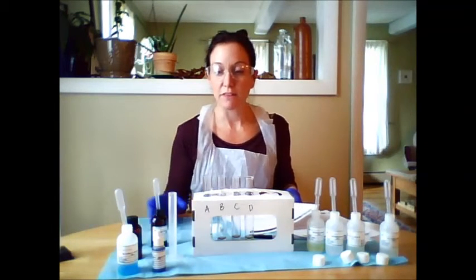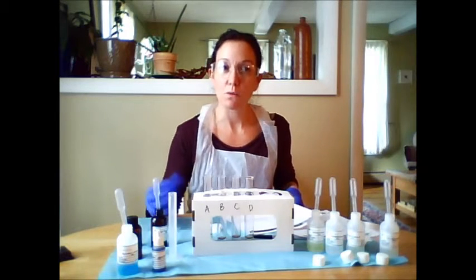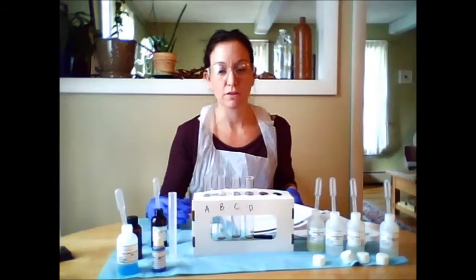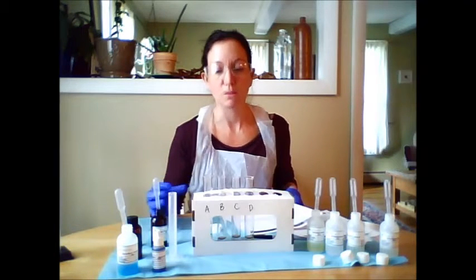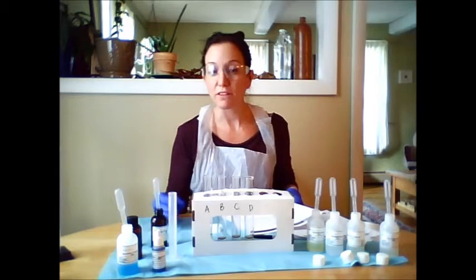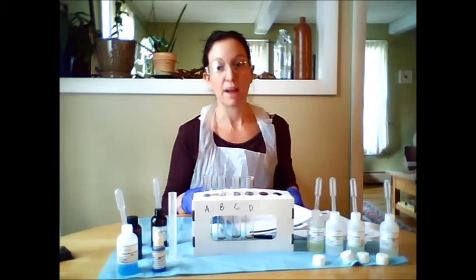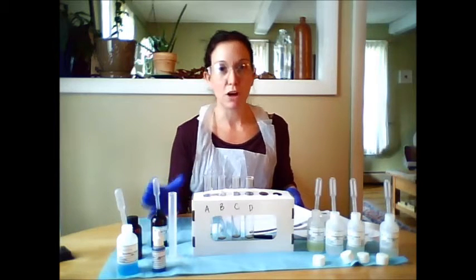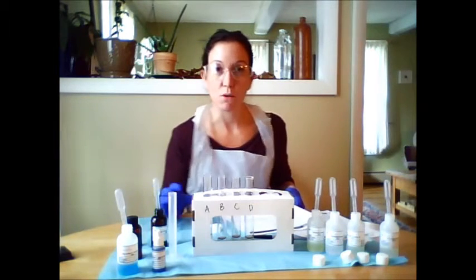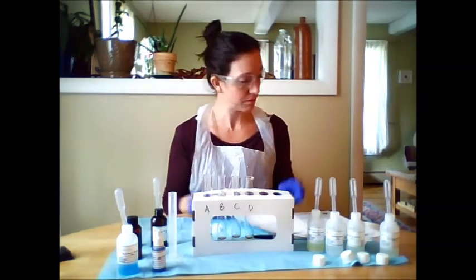Now I just left my test tubes with the Benedict's in a mug of hot water that had just been boiling on the stove. I left it in those test tubes in the mug for 3 minutes and I did see a reaction. So you don't have to keep the test tubes boiling on the stove or in the microwave for that long. A simple large mug to hold the test tubes in the hot water is fine. And with that, I posted a picture of the results.